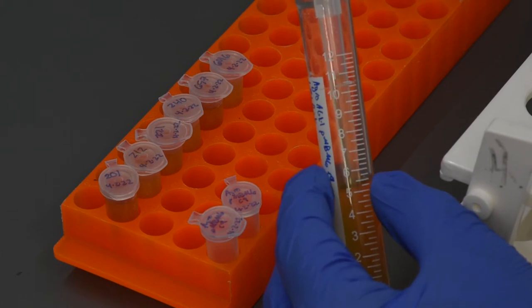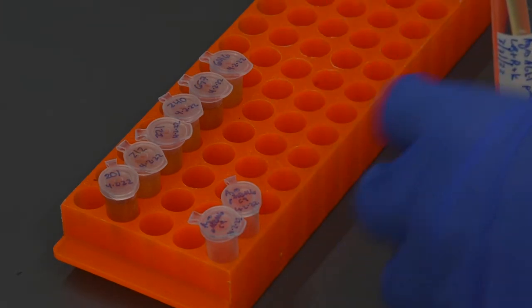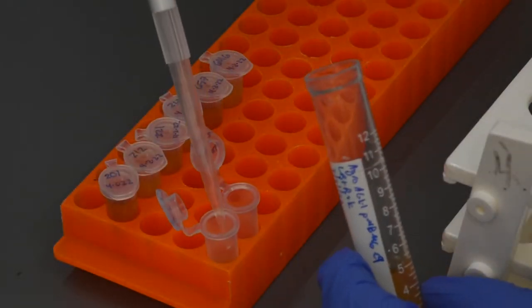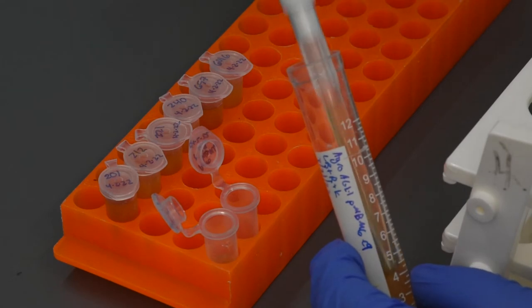Why do I have so many cultures? These shots are combined for multiple experiments filmed over a few weeks. These steps are usually okay to do at the benchtop because we will have selective agents in the medium at later stages.